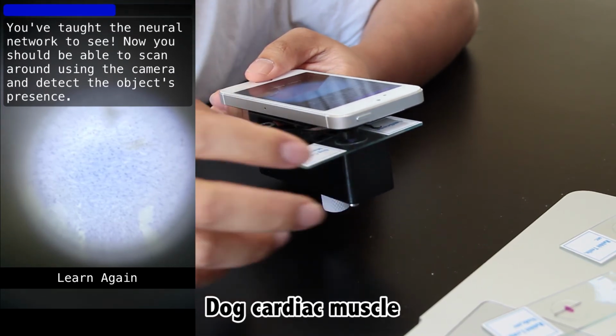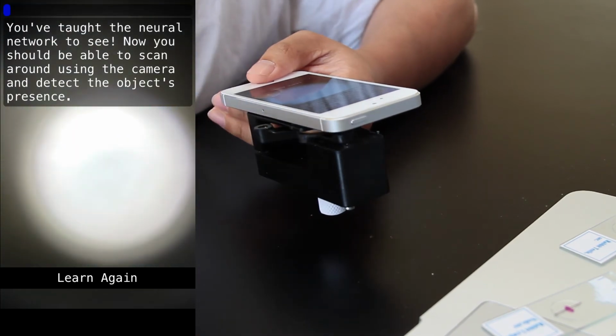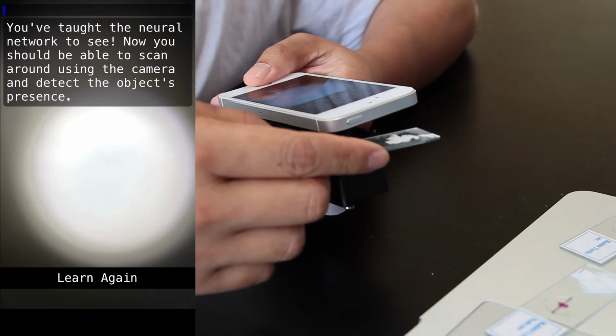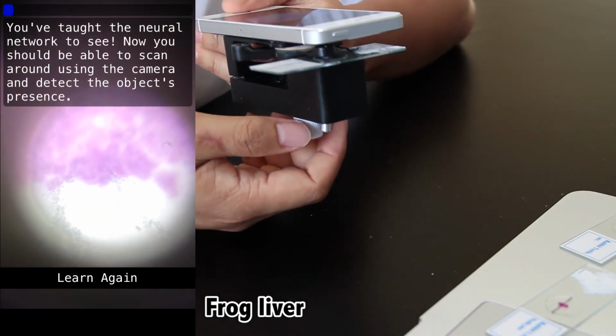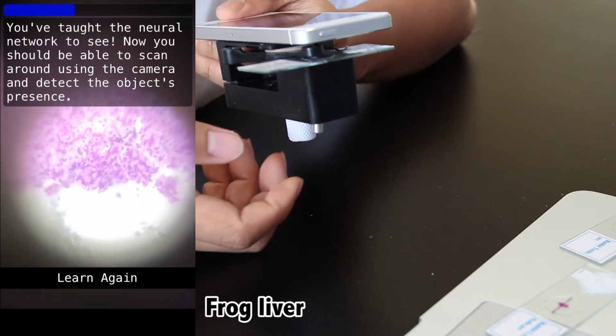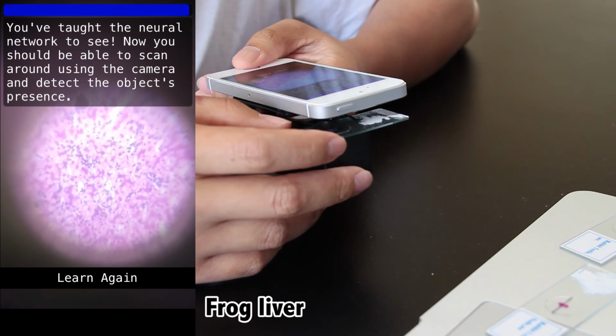And I want to show you this as a disclaimer that this isn't perfect yet. It won't replace your histologist. Right now with this limited app, it's more to show you something cool and how we're getting very close. But of course that doesn't mean we'll never get there. Computer scientists, engineers, and programmers are constantly making these algorithms more accurate, efficient, and accessible every day.